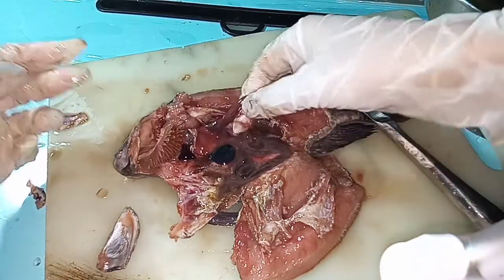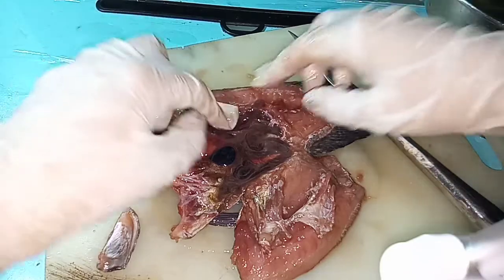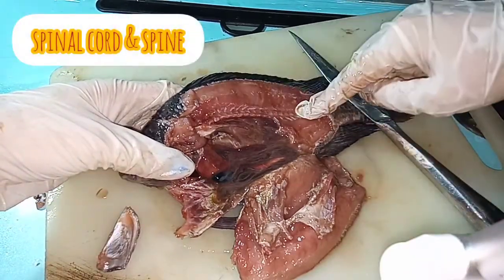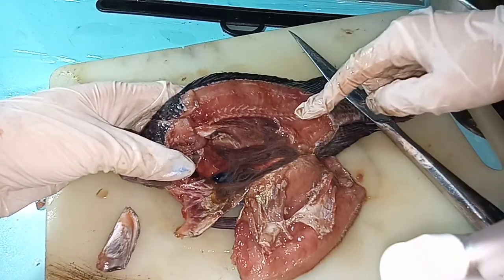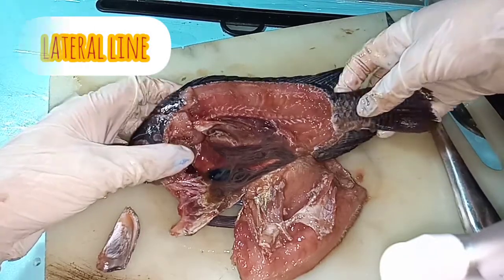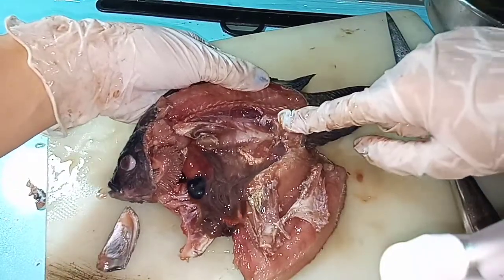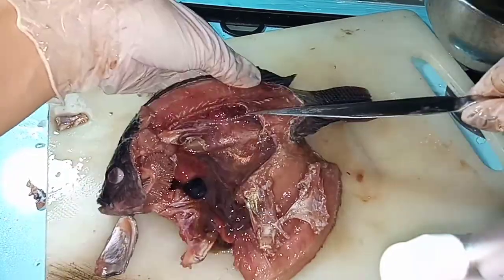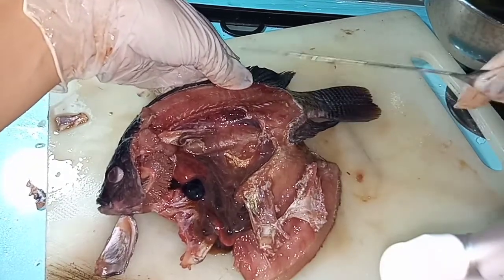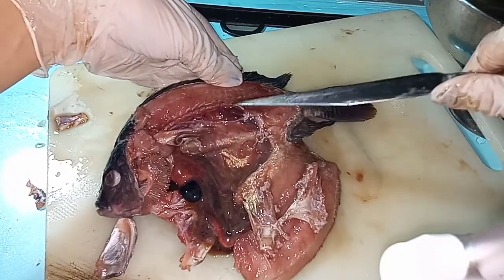Now, let's find the gonad. I believe this is the gonad. Then on this part, we could see the spinal cord and the spine of the fish. And this part, we could see the lateral line. Now, we're going to find the kidney. The kidney is on this part — it looks black on the camera, but it's actually a bit red or brown in person. So, this is the kidney.